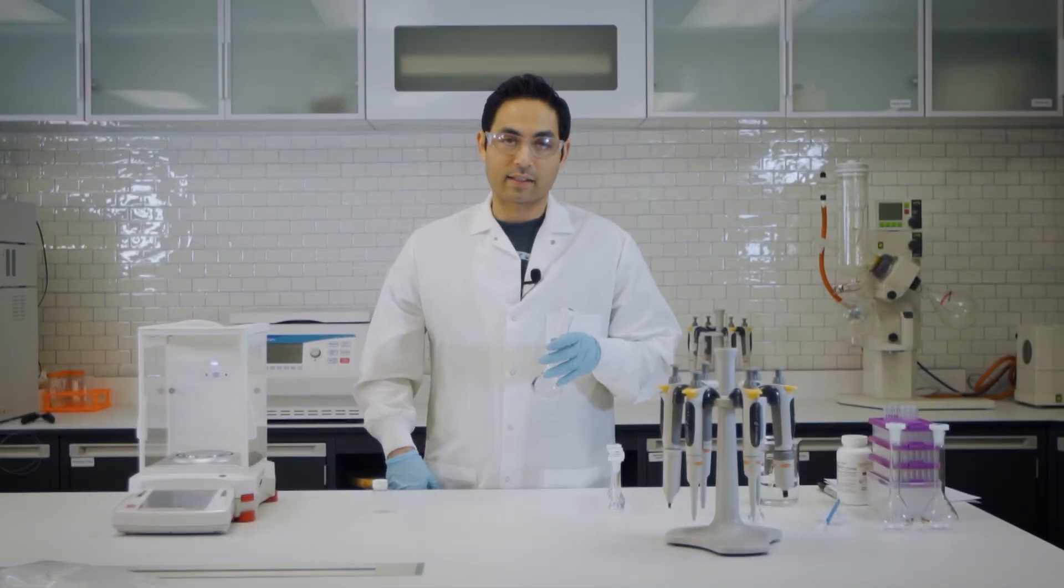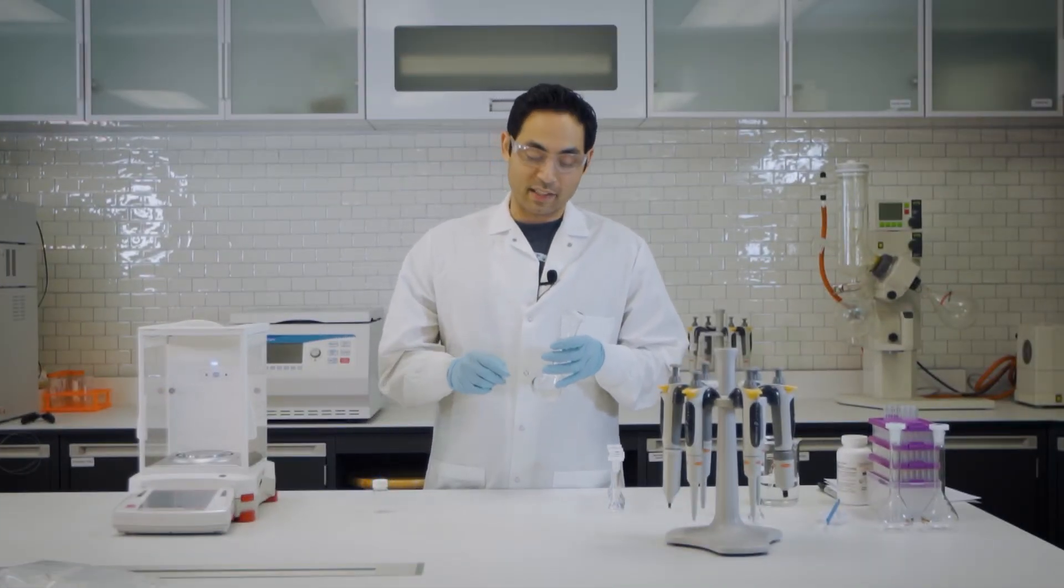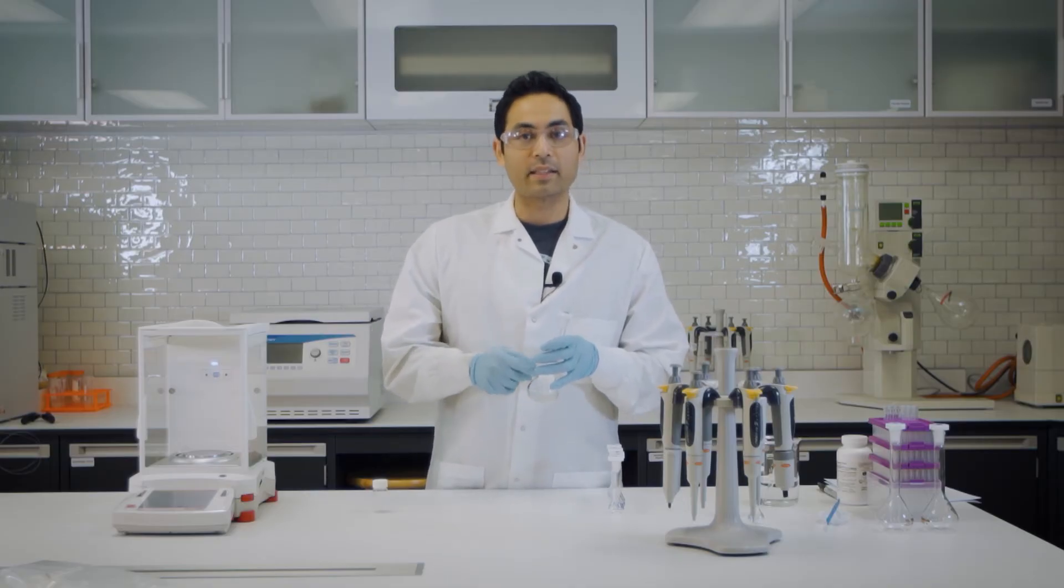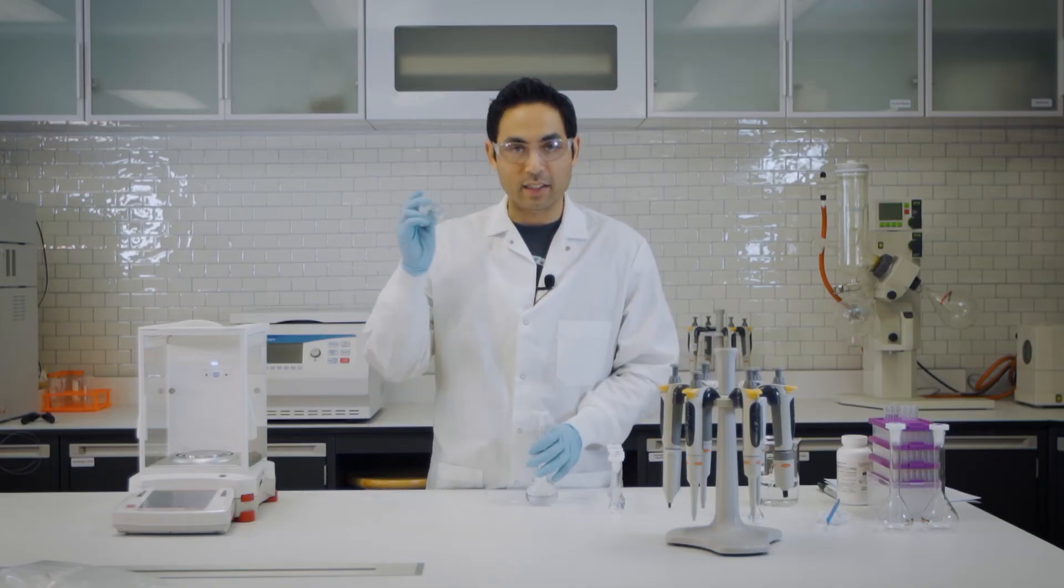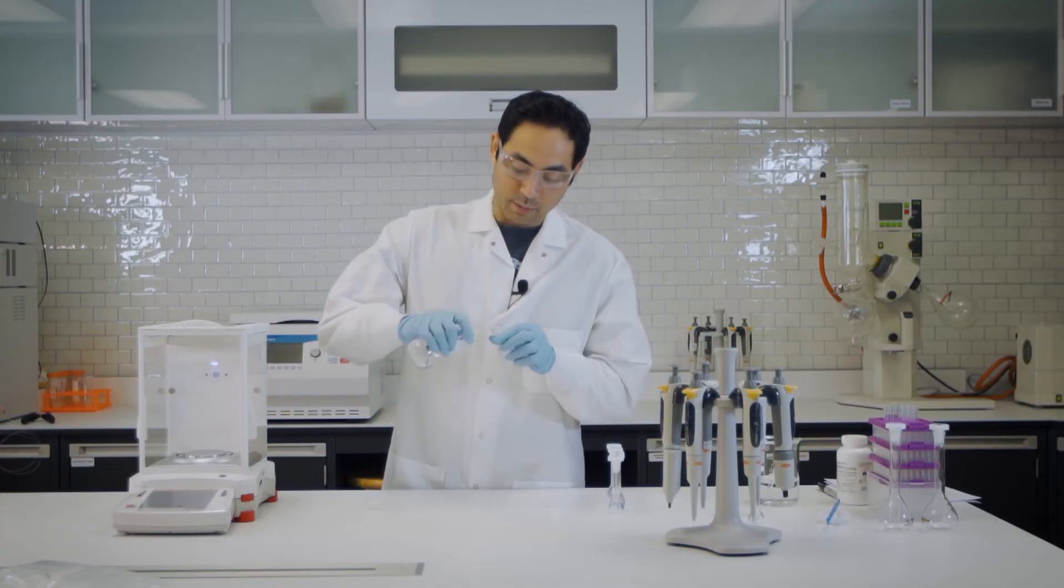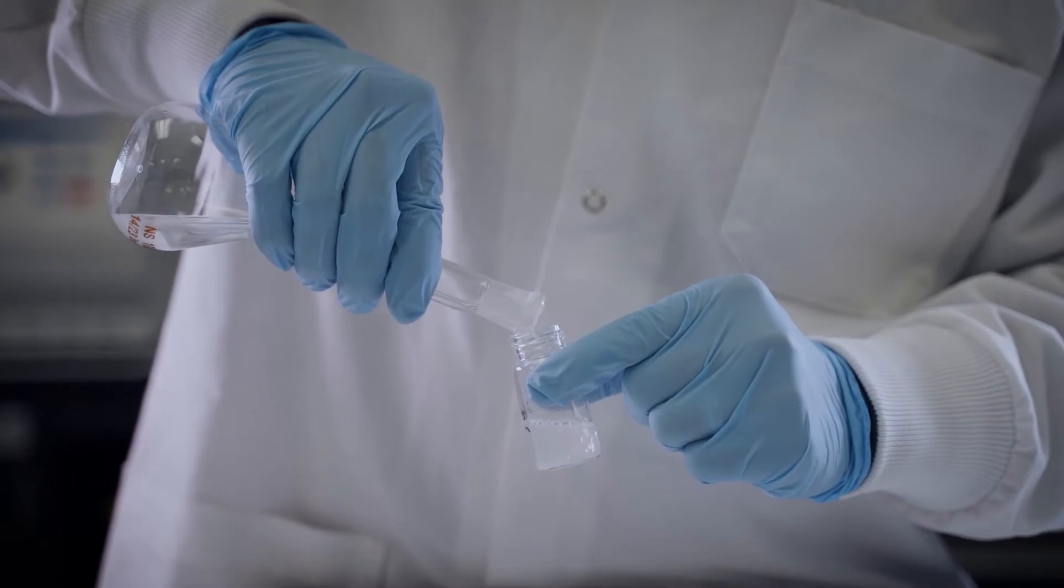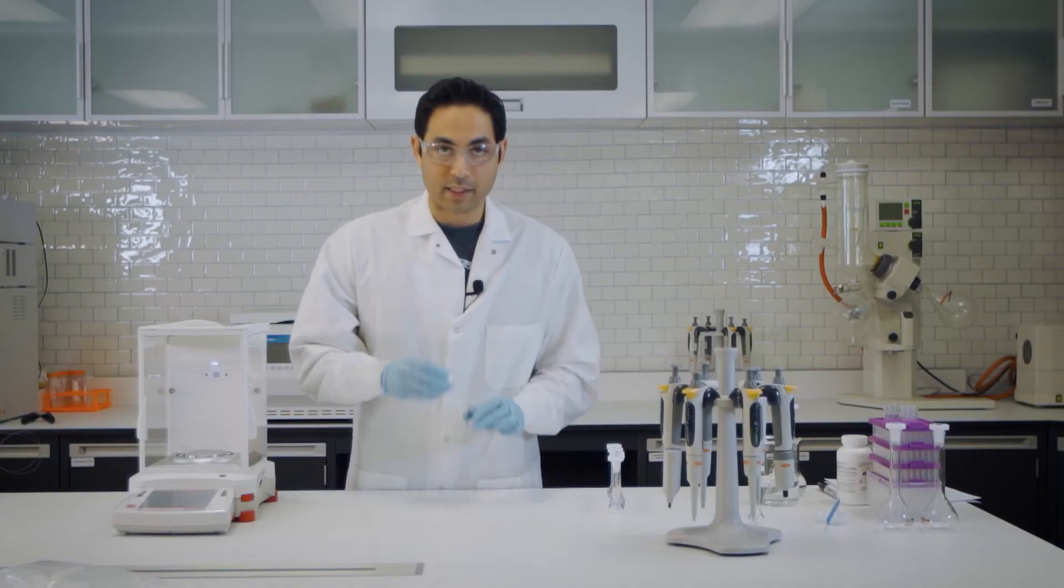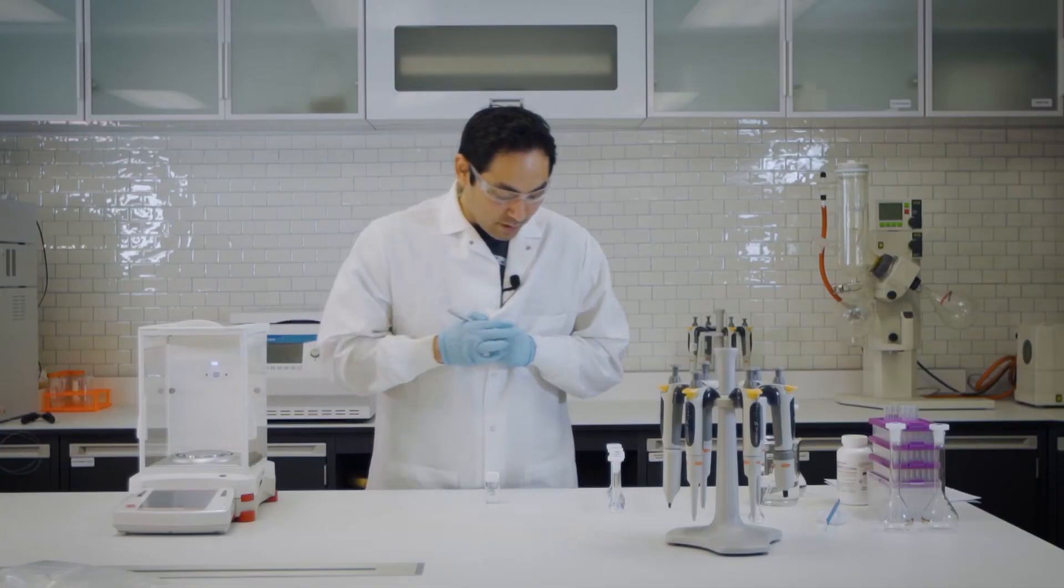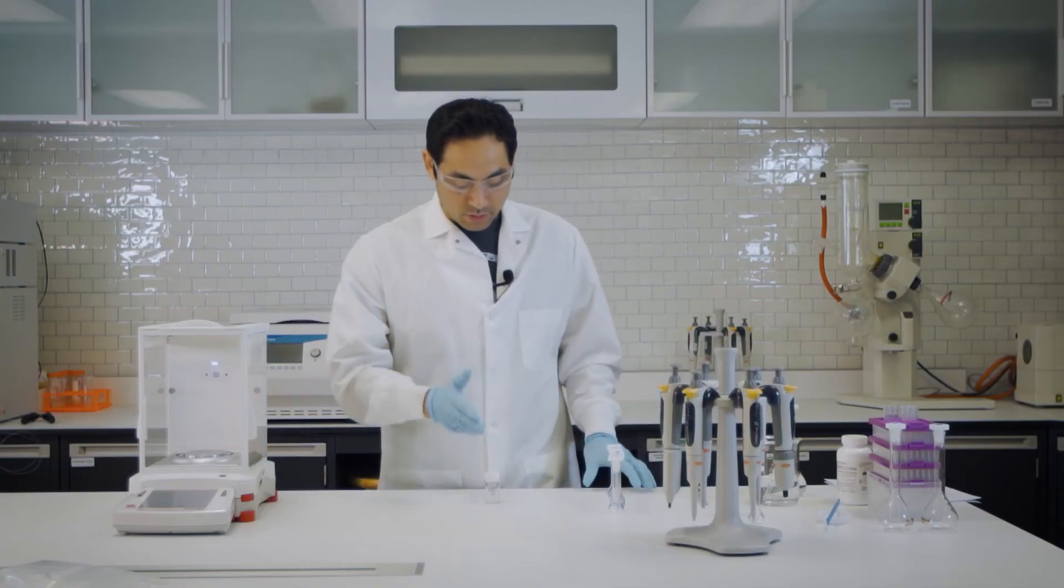So now that we have our stock solution, what I like to do is rather than trying to get a pipette in here, I like to take some of this out and put it in a scintillation vial. So it's just easier to do the dilutions. I'm going to dump it in here and I'm just going to label this properly.